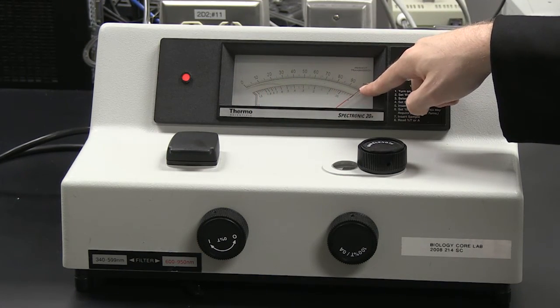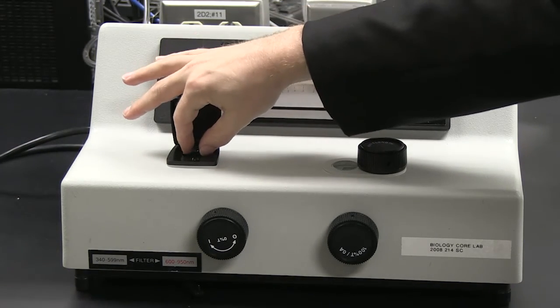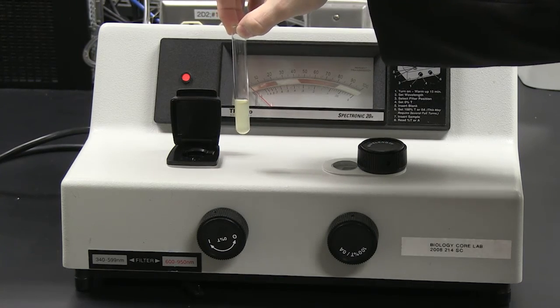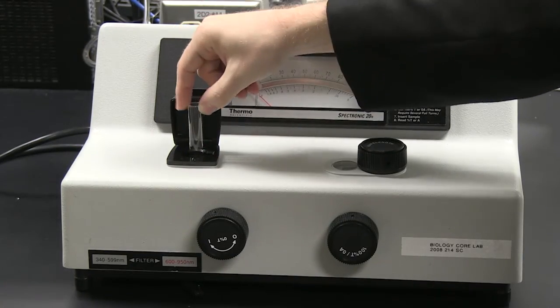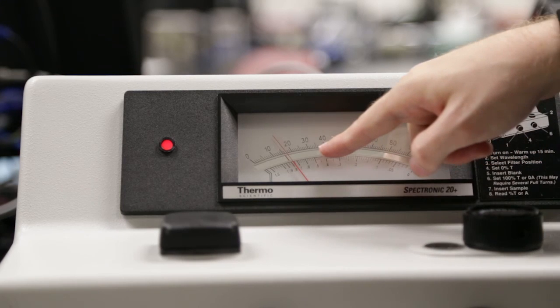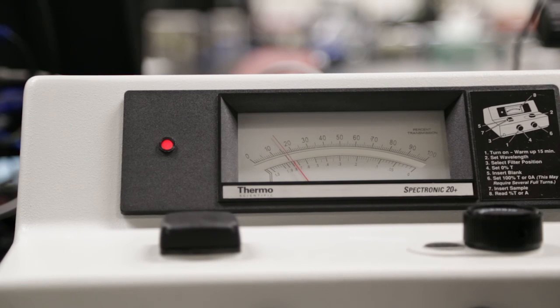The needle is at 0, so the machine is blanked and ready to measure my sample. I take out my blank. I take my sample I want to measure the absorbance of, wipe down the test tube with Kim wipe tissue, put in my sample, close the door, and if I want to read the absorbance, I'll read the bottom scale, and as you can see, the needle is around approximately 0.8. This tells me that my sample has an absorbance of 0.8.